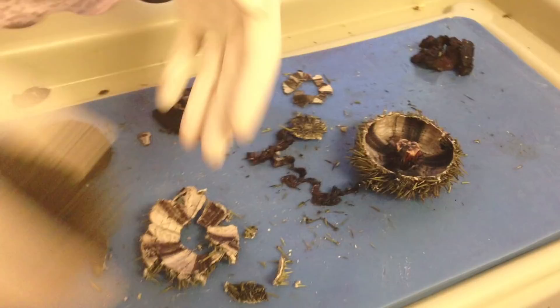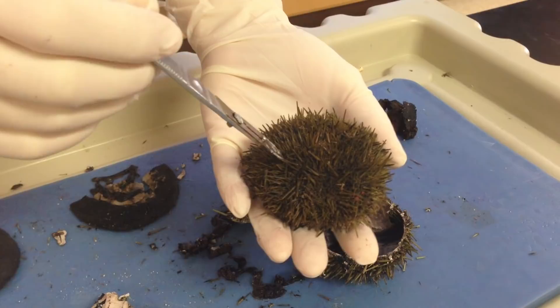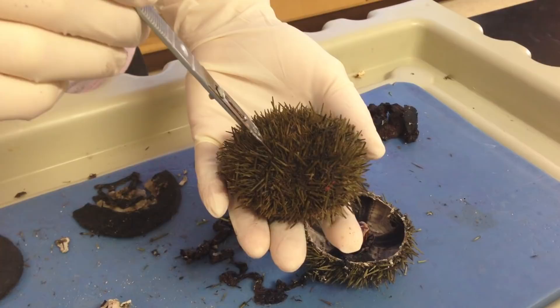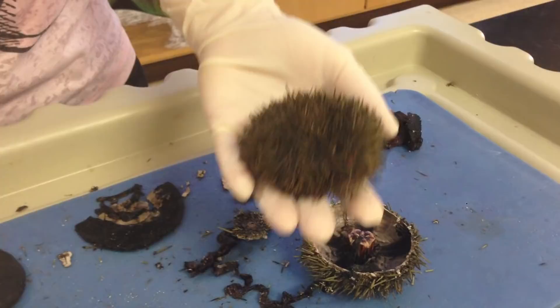What I did was I took the urchin and inserted the scalpel into one area to crack open the test. I did it really close to the periproct so that I can create a circle around the periproct. So you would insert the scalpel and then take your scissors and cut around this particular area. You can see that it's going to be this small little piece that will come off just like that.